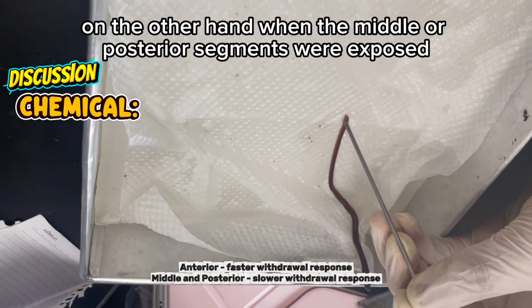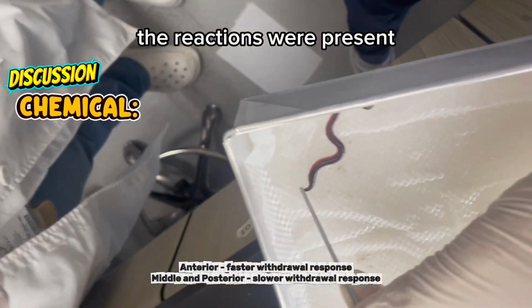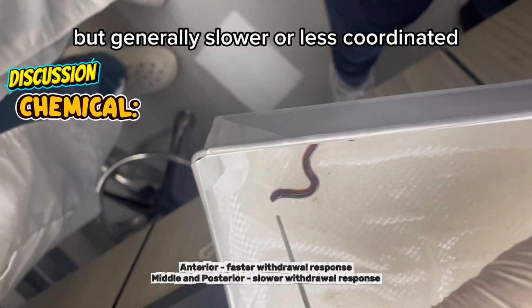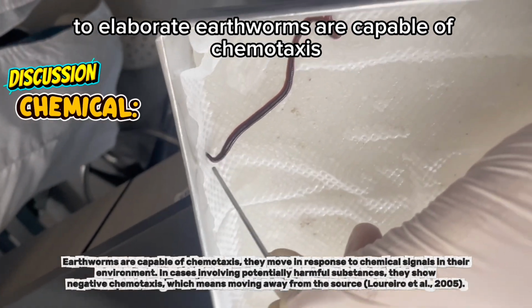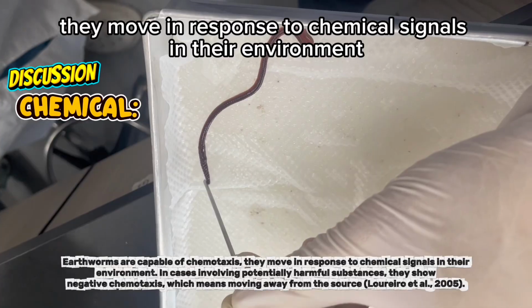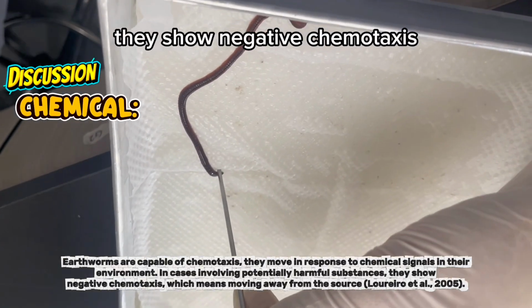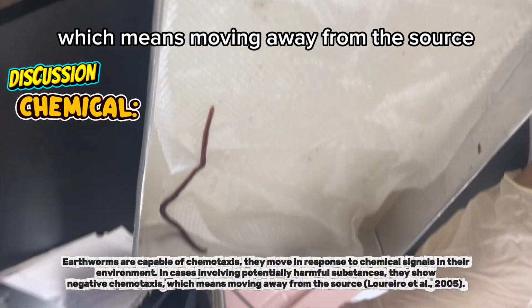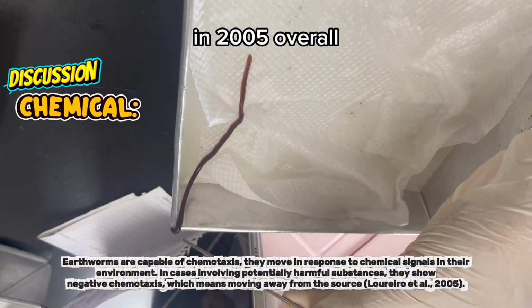On the other hand, when the middle or posterior segments were exposed, the reactions were present but generally slower or less coordinated. To elaborate, earthworms are capable of chemotaxis, which means they move in response to chemical signals in their environment. In cases involving potentially harmful substances, they show negative chemotaxis, which means moving away from the source, according to Loureiro et al. in 2005.